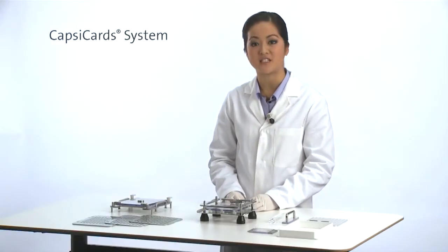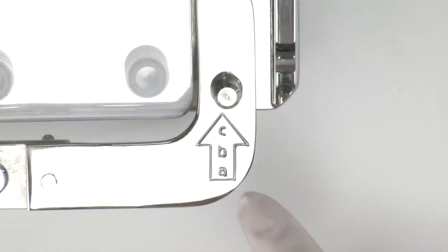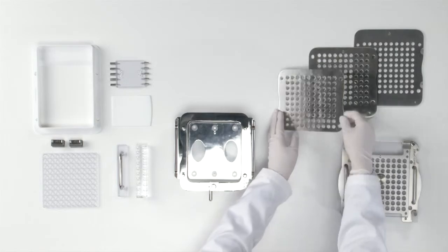Then place body sheets A, B and C on the filler base. The letters A, B and C should be on the bottom right side.